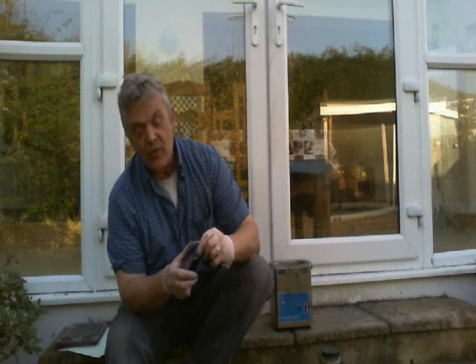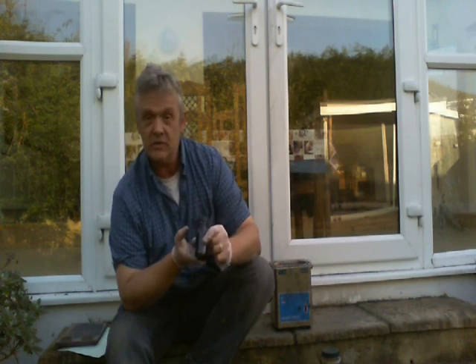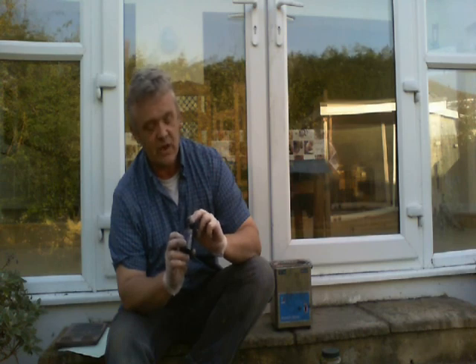You end up with this — a concentrated graphene solution. It's got a little bit of bromine in there so you can wash it if you want, though that doesn't really matter. It stays in suspension quite nicely and can be used as an ink in itself. This is the main constituent of my graphene ink, and I use a fair amount of this whenever I make the ink up, so I need to make a lot of it — and that's how I go about making it.